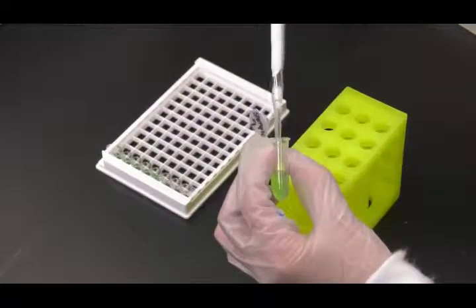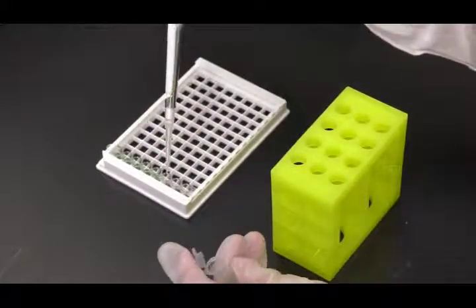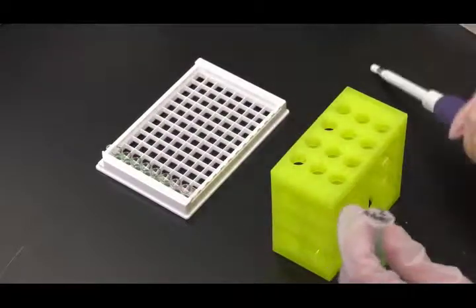Then, pipette 100 microliters of the extracted sample that was prepared earlier into a well.